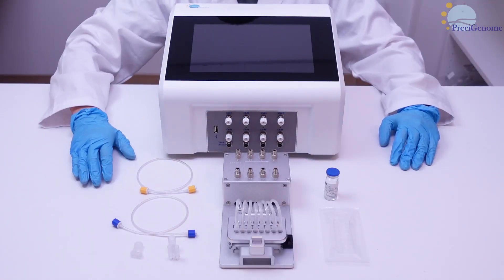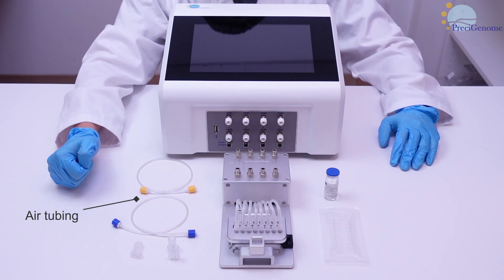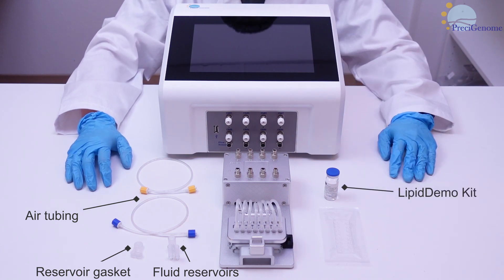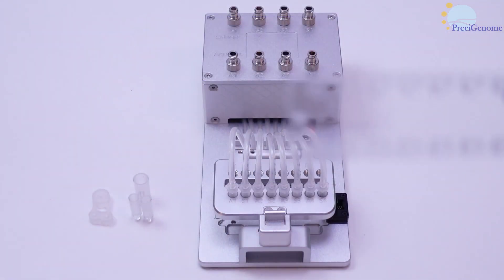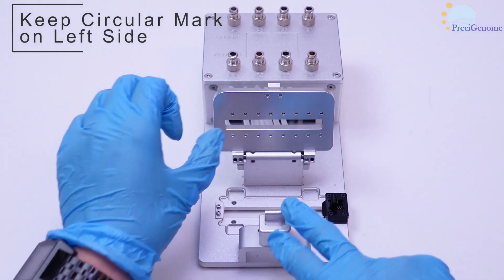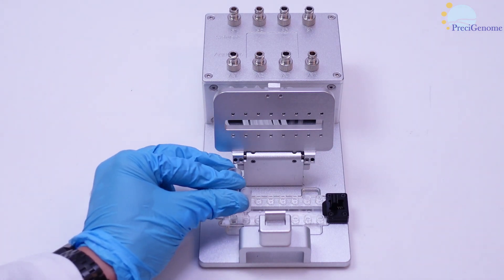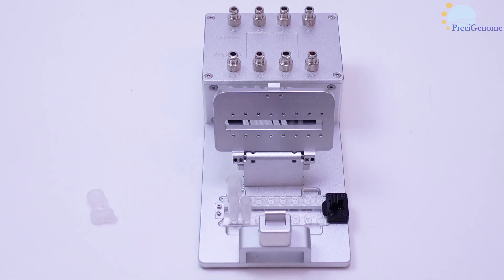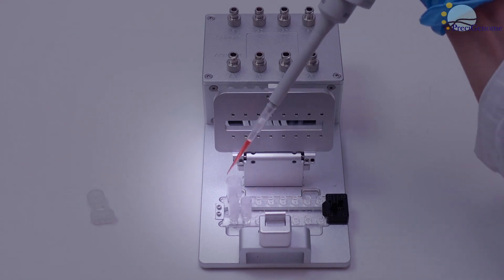Now let's go over what comes with the Nanogenerator FLEX-S. Aside from the mount itself, you get air tubing, fluid reservoirs and gaskets, a lipid demo test kit, and a MIX4 chip. The MIX4 chip has a circular mark on one side to help you orient it on the mount. As you insert the chip, ensure the mark is on the left-hand side of the setup. Now we can insert the fluid reservoirs — the smaller paired ones should be closer to you. These are the inlets for your reagents. Load the right reservoir with your lipid solution and the left with aqueous buffer. We have dyed ours for increased visibility.